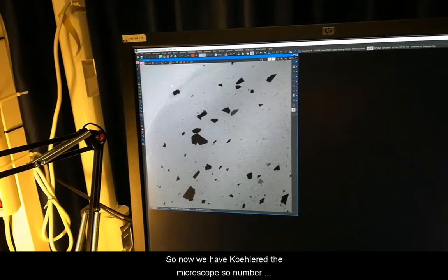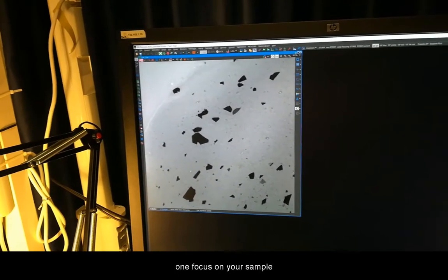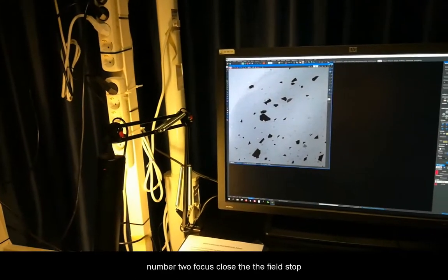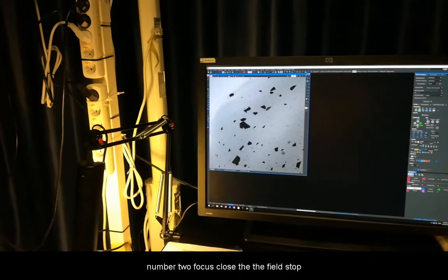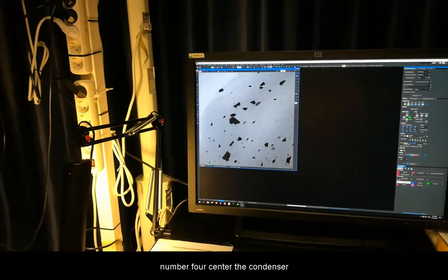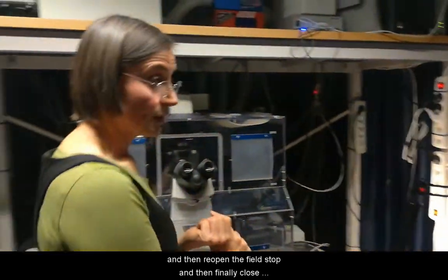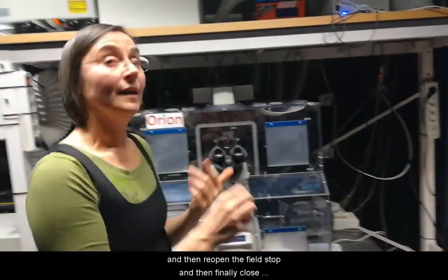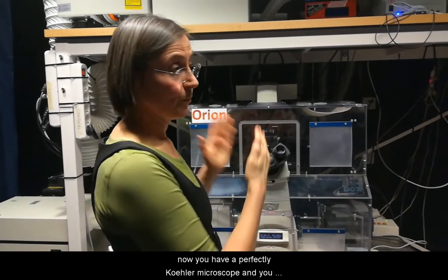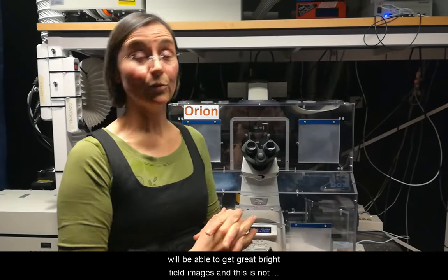Now we have done Köhler illumination. To recap: number one, focus on your sample; number two, close the field stop; number three, focus the condenser; number four, center the condenser and then reopen the field stop; and finally, close the condenser aperture. Now you have a perfectly Köhler-illuminated microscope and you will be able to get great bright-field images.